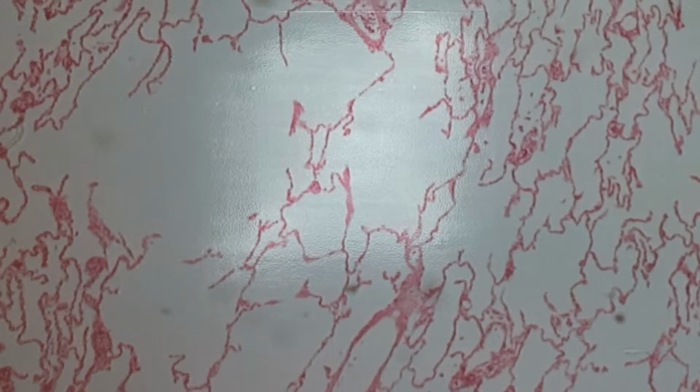So single lines, or what? Type 1. Where they combine, type 2. And this whole slide looks like nothing else, so you shouldn't have any problem distinguishing this as the lung. So space is the alveolus. Capillaries, they may or may not have blood in them. The visceral pleura at the very edge, and then our type 1 and type 2.